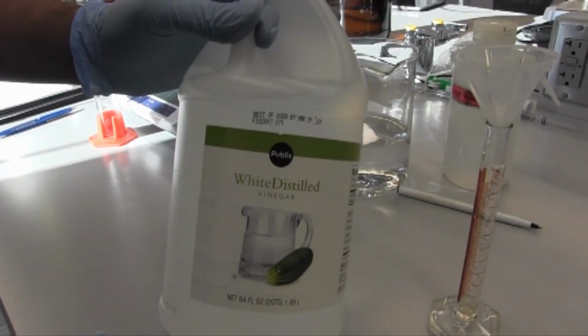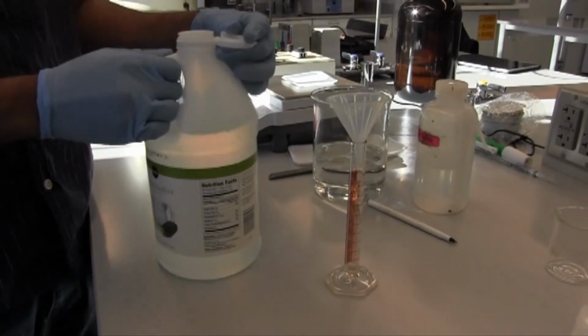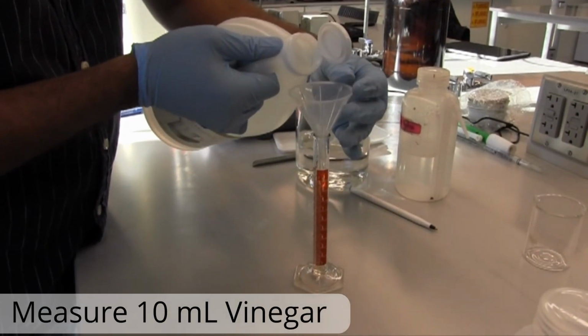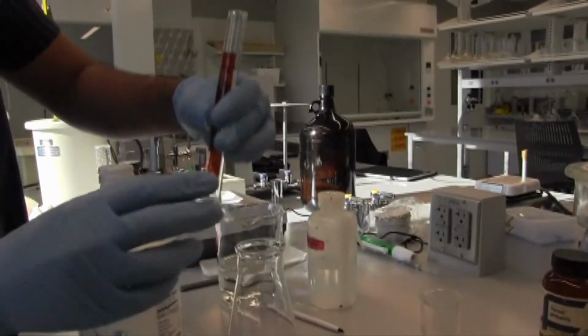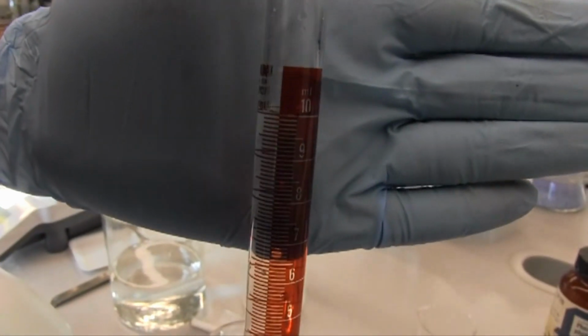So in part 1, we standardized our sodium hydroxide concentration. We should figure out the molarity of that. In part 2, we're going to figure out how acidic some basic Publix vinegar is. So we're going to take that vinegar straight from the jug and measure out about 10 milliliters of it. So you can see 10 milliliters right there.